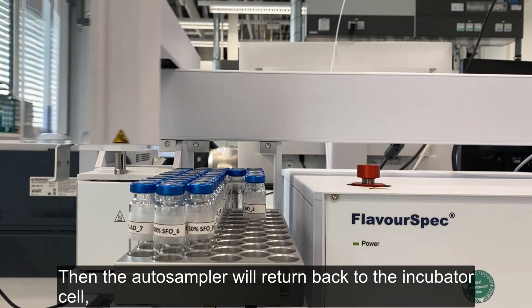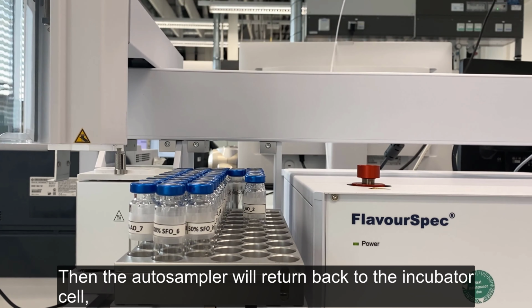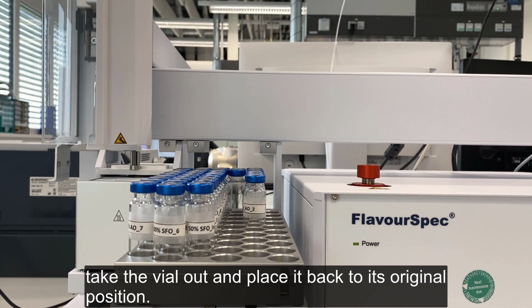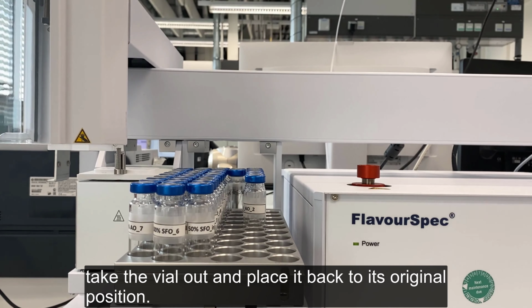Then the auto-sampler will return to the incubator cell, take the vial out, and place it back to its original position.